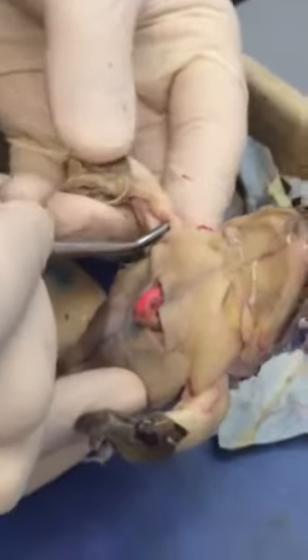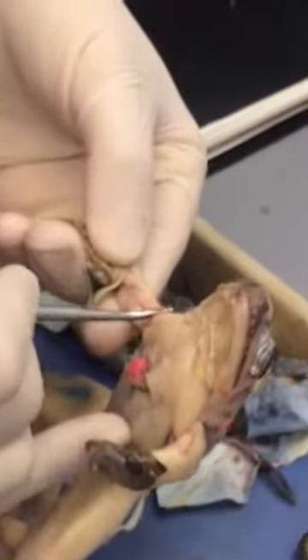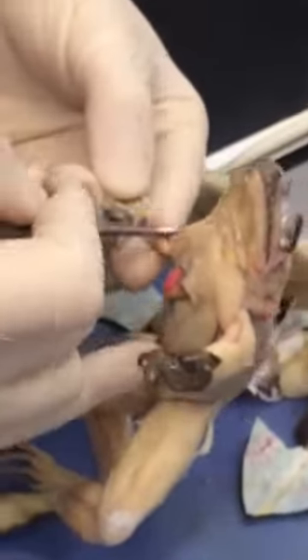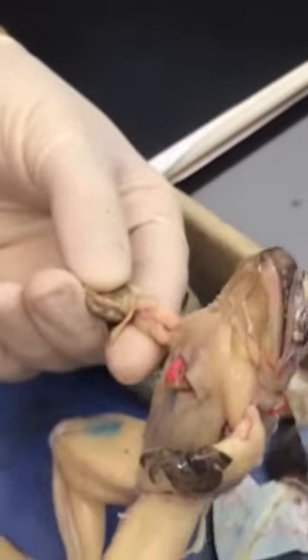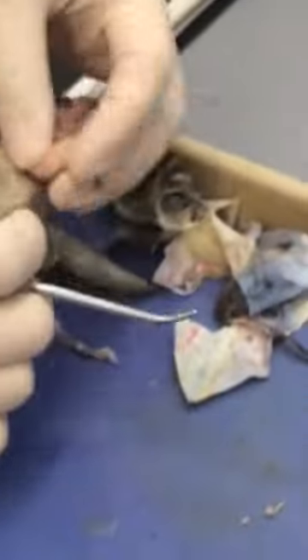Right over here — that's the deltoid, right here, the top muscle like where our bicep is. See that? I was making up a name for it — it's the deltoid. And the anconeus, which is right here.